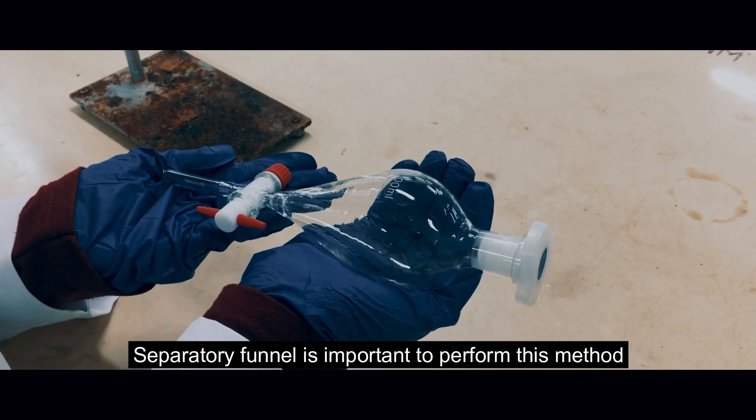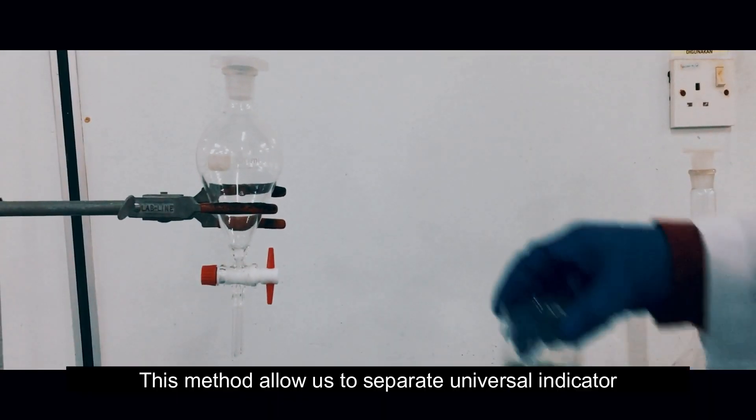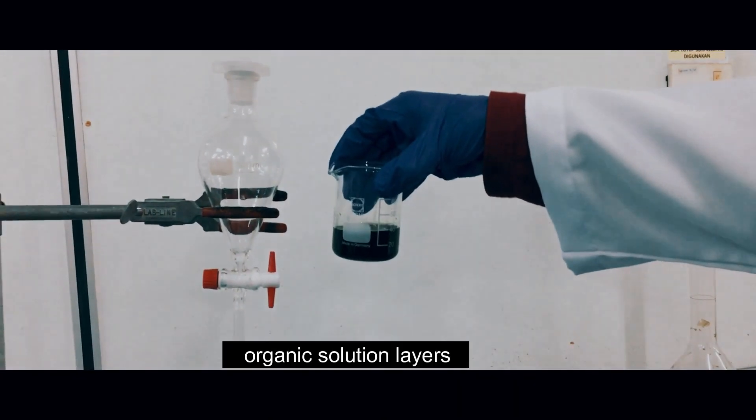Separatory funnel is important to perform this method. This method allows to separate universal indicator and organic solution layers.